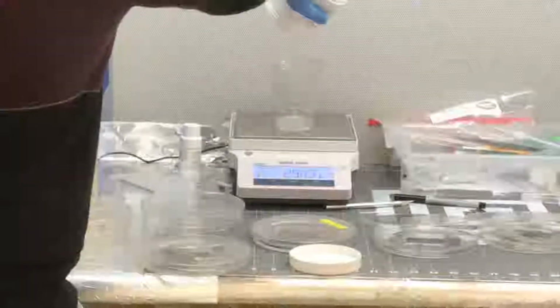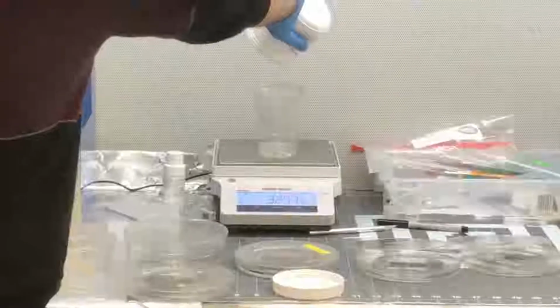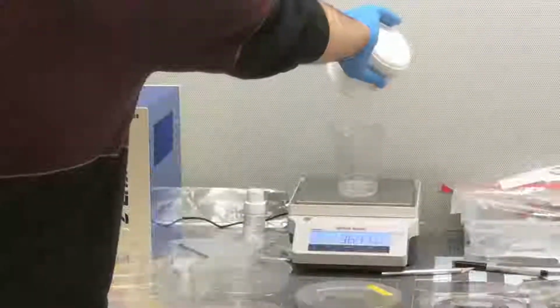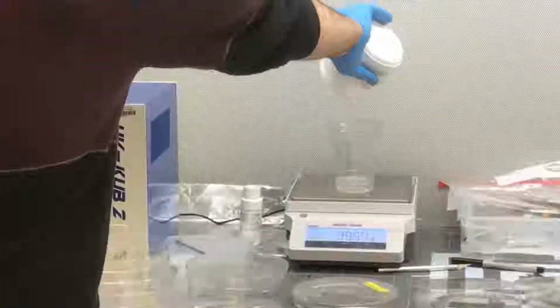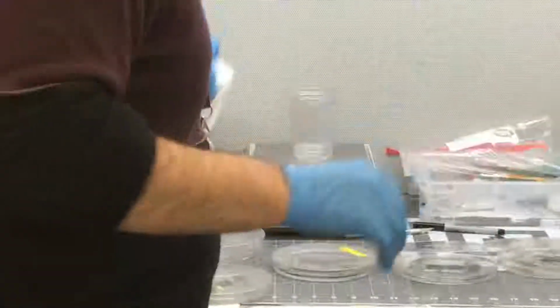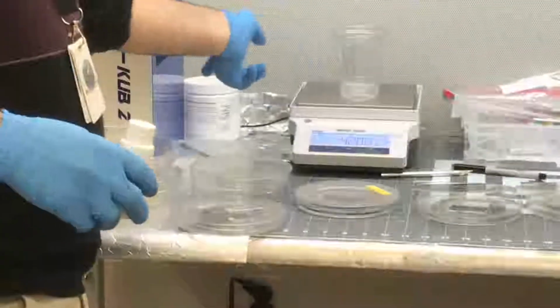So Ali, you said that you determine the height of the chip that you want to make, and the area of the surface of your master mold. But then how is this converted to weight? I told you, this calculation you can calculate. Where is that calculation? This is also based on each chip. It's available everywhere, just search on the internet. For example, now I put 42 gram of the PDMS.